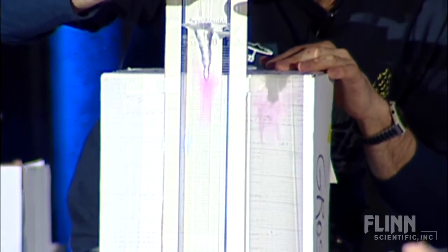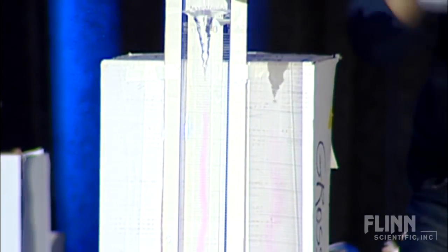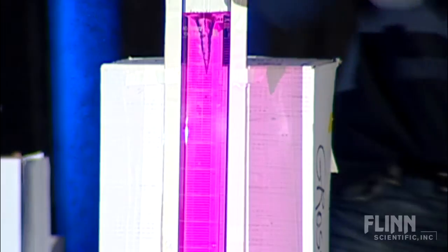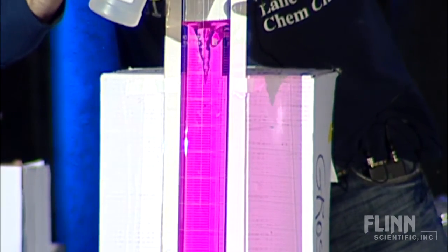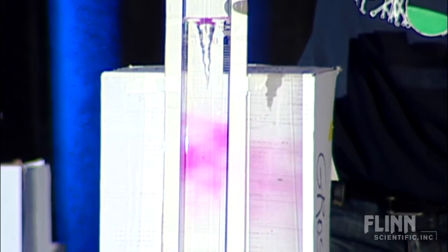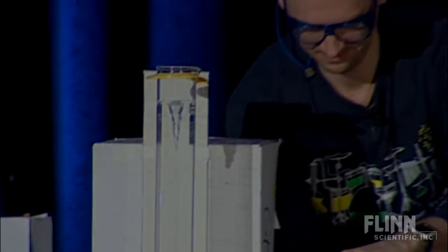But if I keep on adding, adding, adding — and then if that doesn't work, we could just add more and see what happens. And then we have our pink, because there's too much base. Then we could overload it with acid, and then it should become clear again. All right. Thank you.